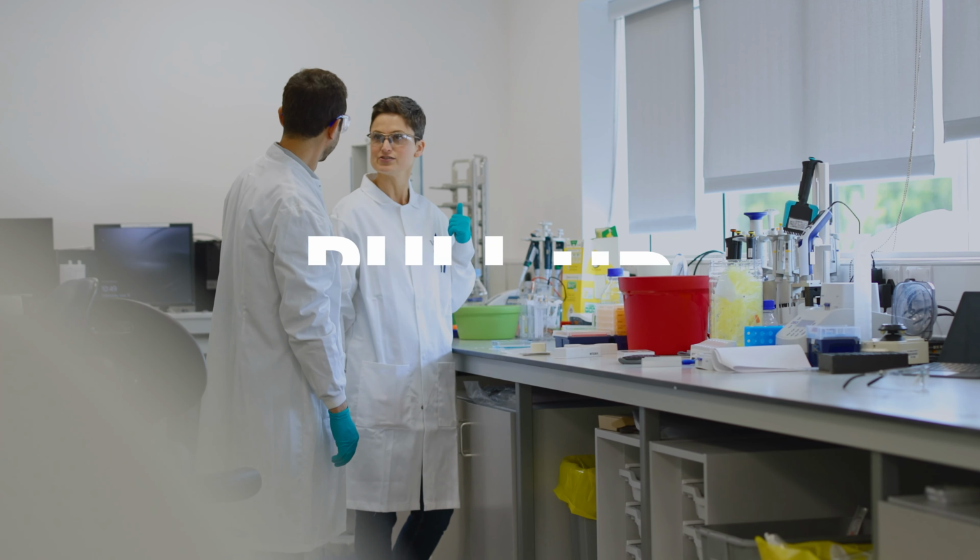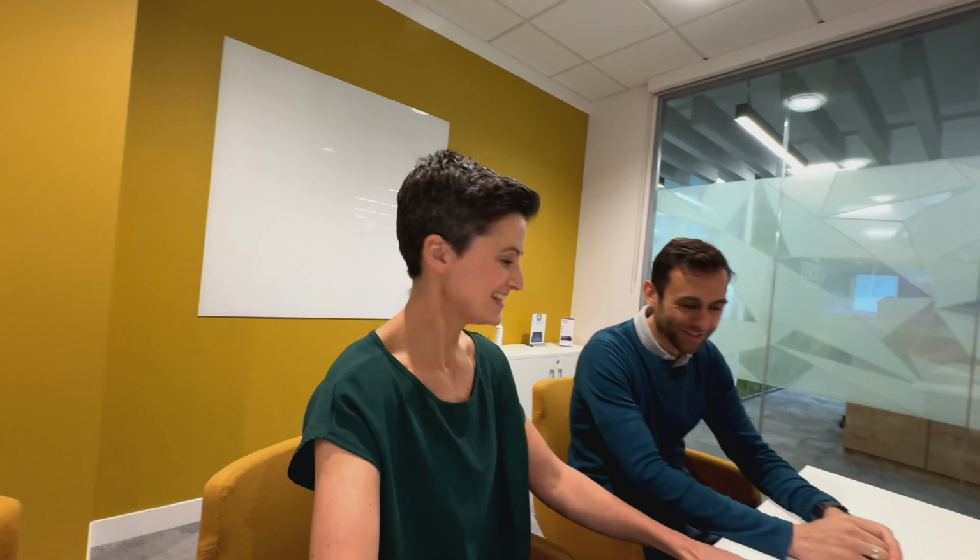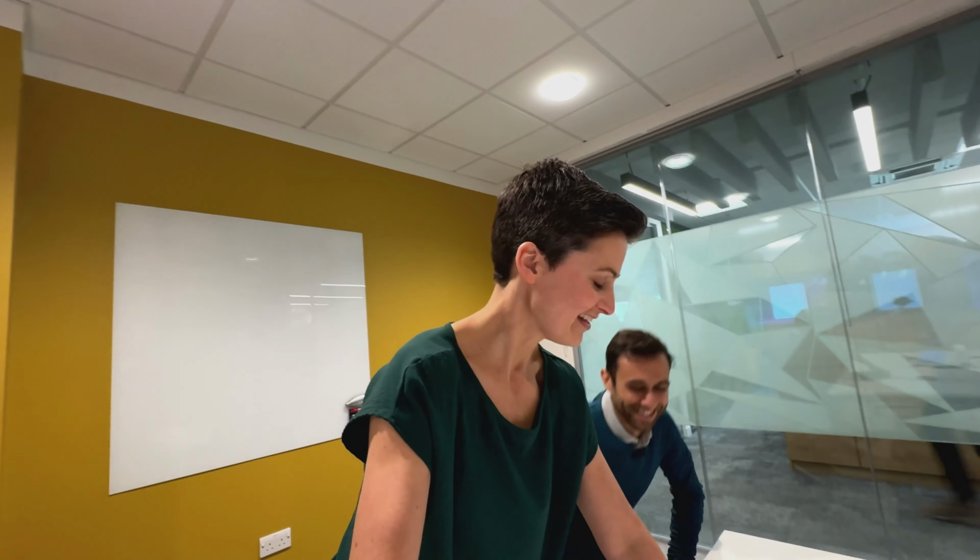We designed some new constructs that will help not only the expression in the cells, but help us to be able to pull out purer protein. We'll get some of those constructs ordered, do the test expressions, and then put them into some cells. Sounds good. Exciting. Yeah, I think this one's going to work.